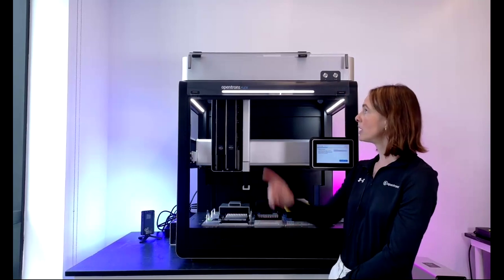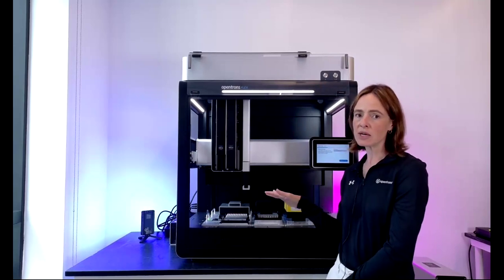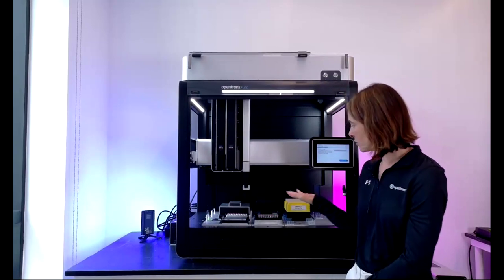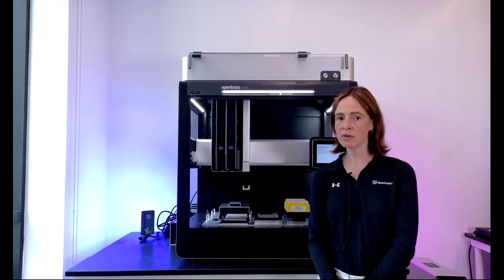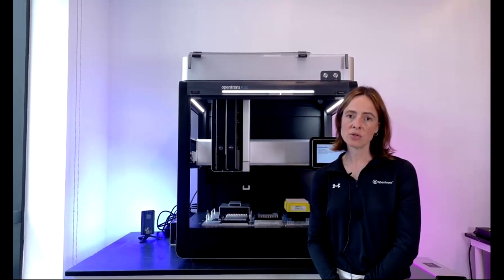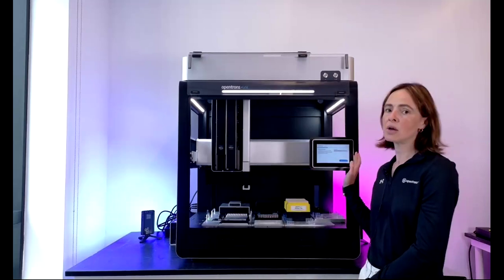And finally, I mentioned at the beginning, we just recently launched this HEPA UV accessory that sits neatly on top of the robot and allows you to sterilize the deck surface and also filter contaminants from the working area. And as I mentioned before, all of this is completely modular. So you're not tied to this robot doing one thing forever. You can easily swap out pipettes, modules, and so on to change the application that you're using it for or to increase your throughput.